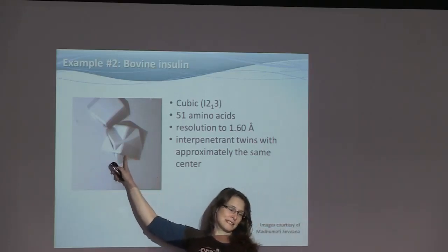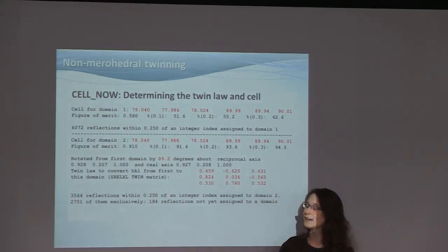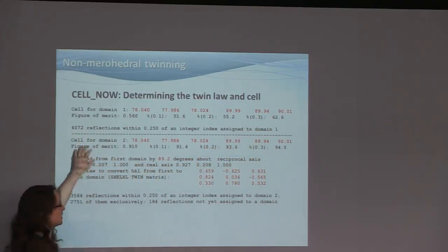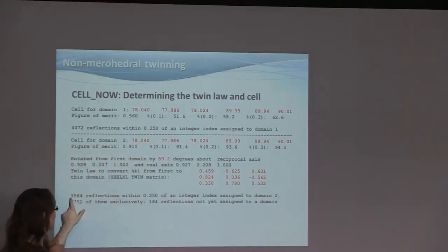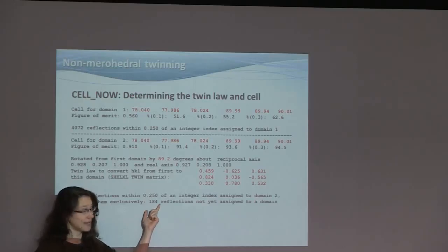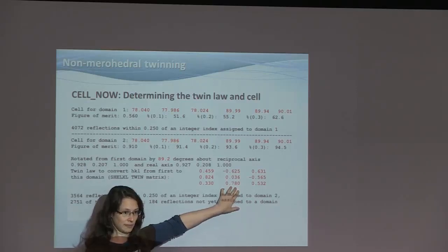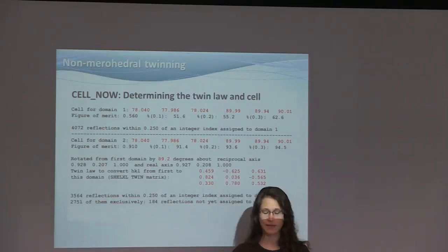Now, this crystal could possibly be centered correctly with both domains because they have about the same center. If we do that in CellNow, and I'm only showing this in CellNow because CellNow gives nice statistics, you get the first domain, and it gives you this cell. We were able to index 4,000 reflections to this domain. Then we have a different orientation of the same cell, and we were able to index 3,500 reflections, leaving us with 184 that we have not indexed, which may well be noise. And we get a twin law, which is a rotation by 90 degrees about the reciprocal axis, resulting in this twin law. So that's then the transformation that gets you from one domain into the second.